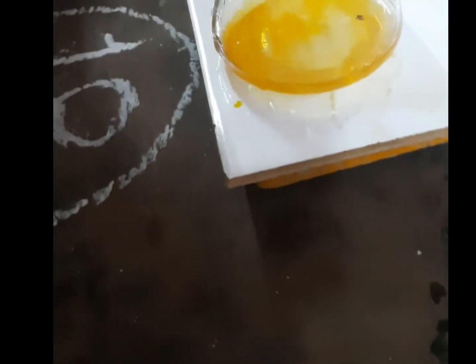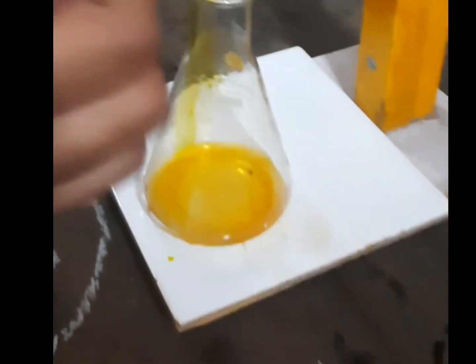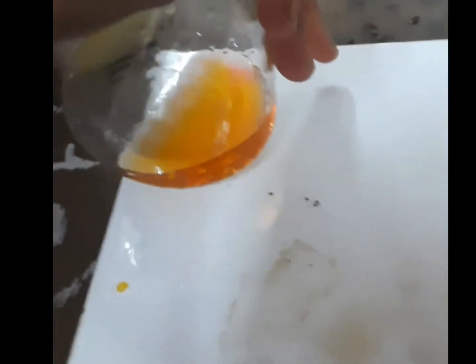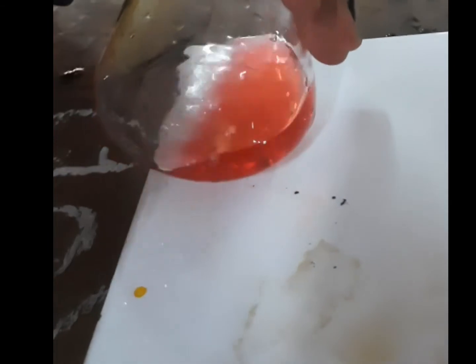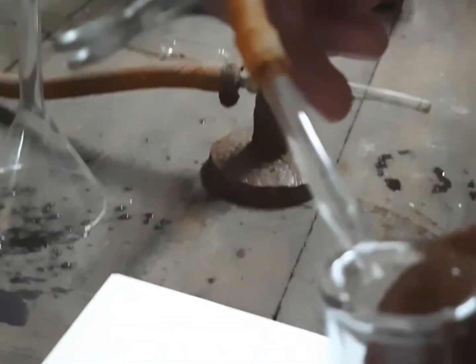Now add methyl orange indicator for the second neutralization point, since the first half neutralization point was indicated by phenolphthalein. Add a few drops of HCl solution from the burette and observe the color change — drop by drop addition is very important for accurate reading. The yellow color turns to slightly pink color; this is the second end point of the titration. Note the reading, which should be 3.1 cm³ considering the lower meniscus.